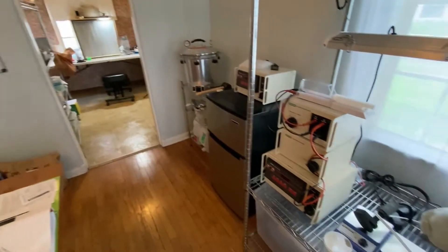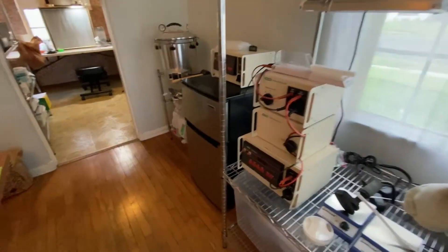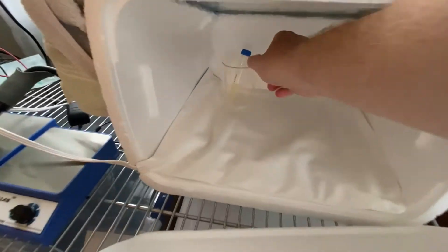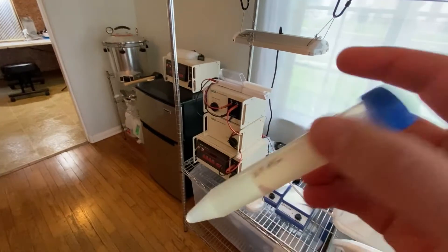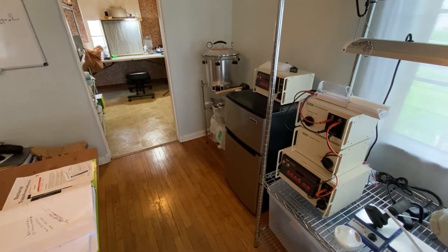Now that we've spent quite a bit of time this week getting the Spanish plasmid prepped with a new mini prep kit — at a higher concentration confirmed on the gel and without any ethanol — we are ready to take some of this new overnight culture of DH5-alpha and see if we can get good transformation rates with electroporation.